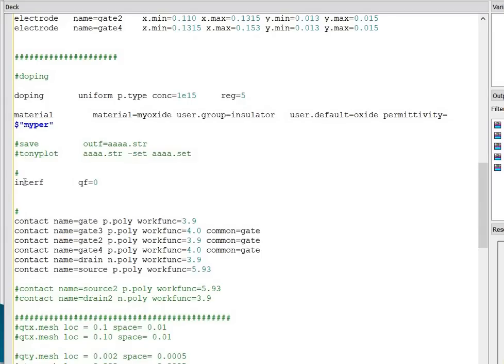Next, I have defined the material statement. I am introducing a new material with the name my oxide material. With the user.group it is the insulator material and the user.default is the oxide, and the permittivity I have fixed at 1.